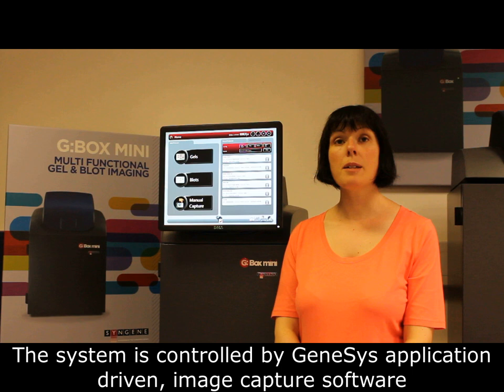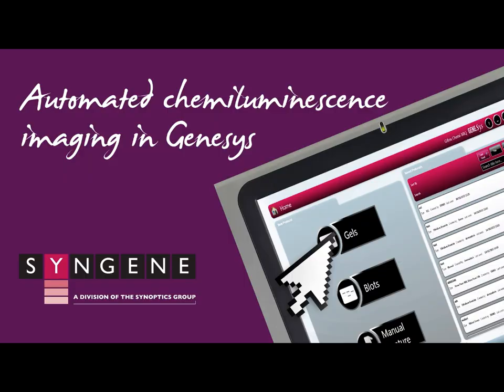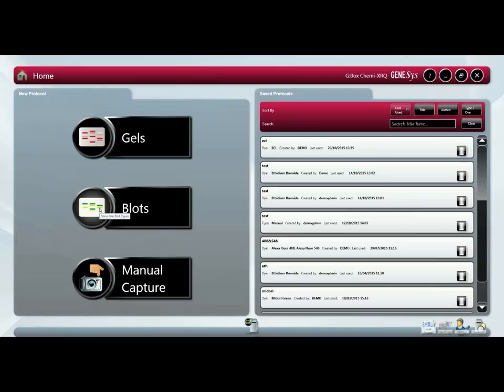The system is controlled by Genesys application-driven image capture software and comes complete with unlimited copies of Gene Tools analysis software.